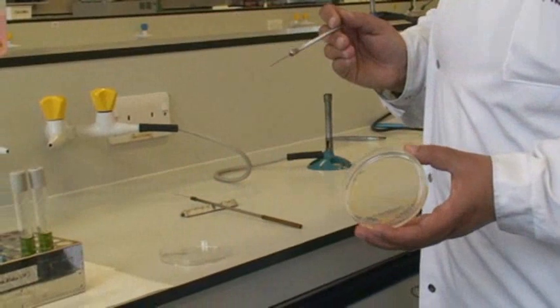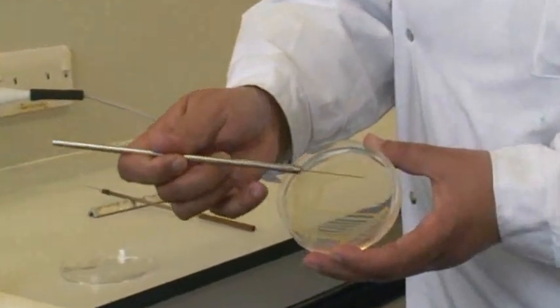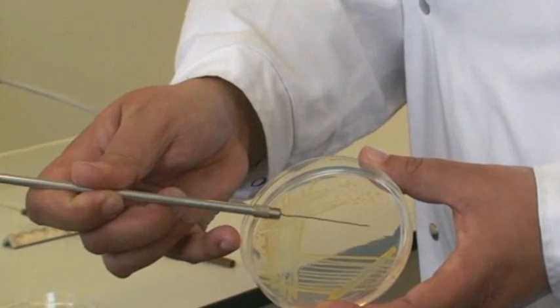So this is the bacteria on the agar plate, and I'm just going to pick one colony. That will be sufficient.